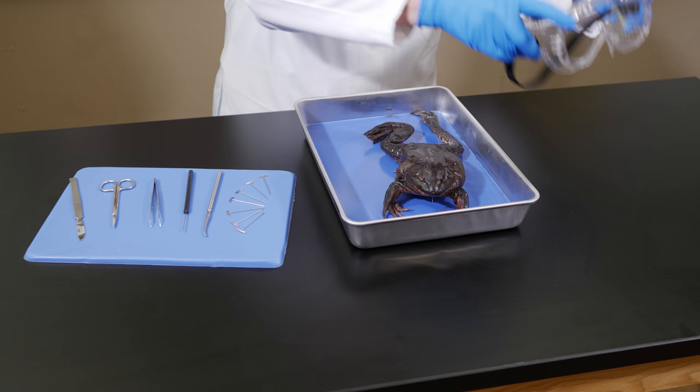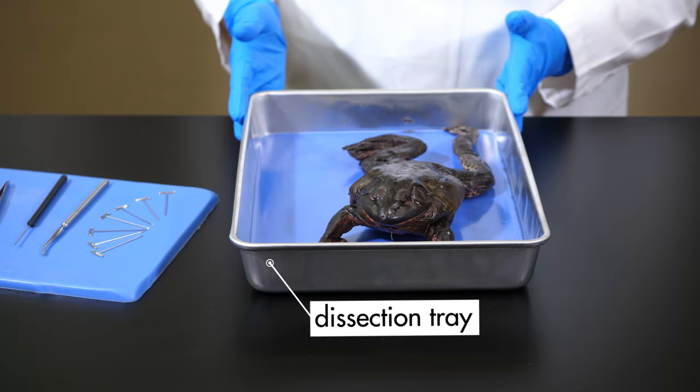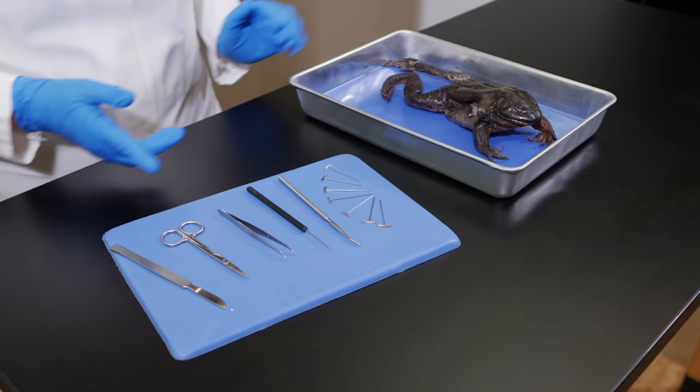As always, be sure to use the proper protective outerwear before beginning a dissection. A basic dissection kit should contain the following instruments.